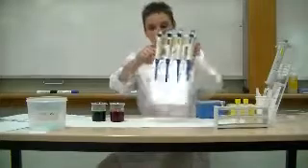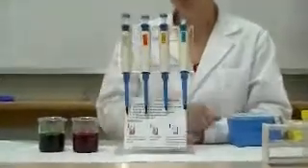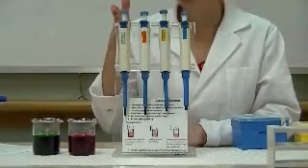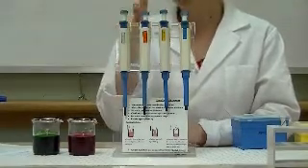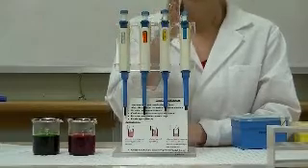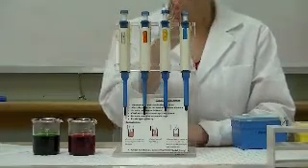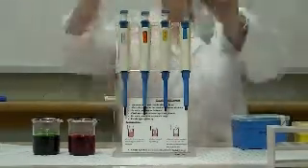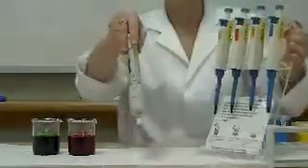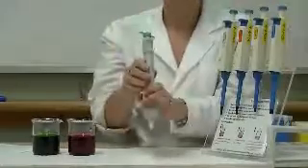So these are the pipettes that you are likely to see in your prac classes here. They come in a range of different volumes. The smallest being 0.5 to 10 microlitres, 5 to 50 microlitres, 50 to 200 microlitres and 200 to 1000 microlitres. You will also come across this larger pipette, which is a 1000 to 5000 microlitre pipette.